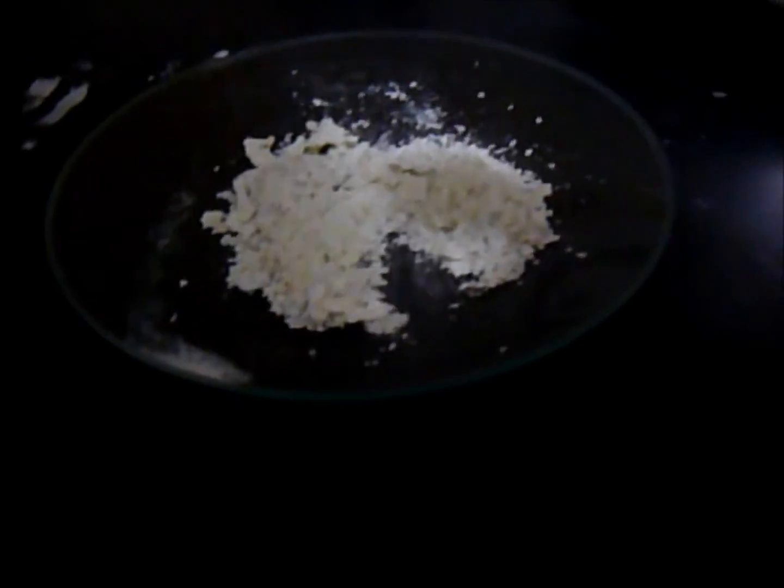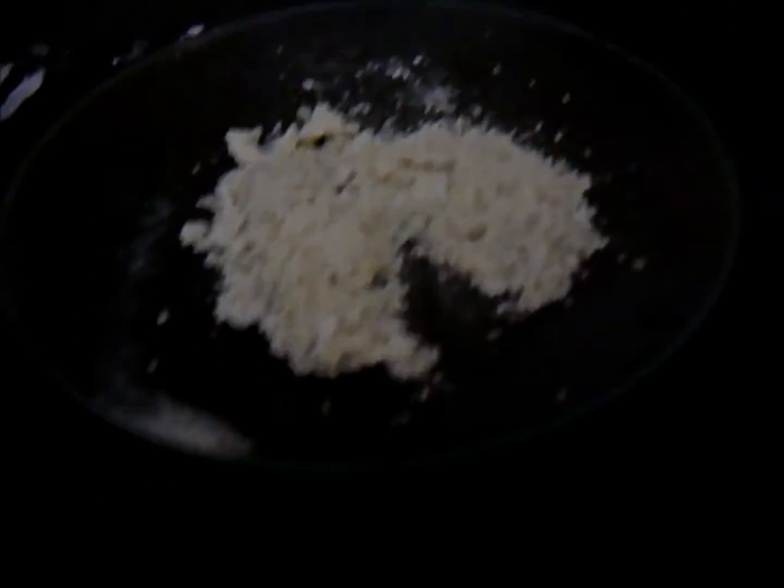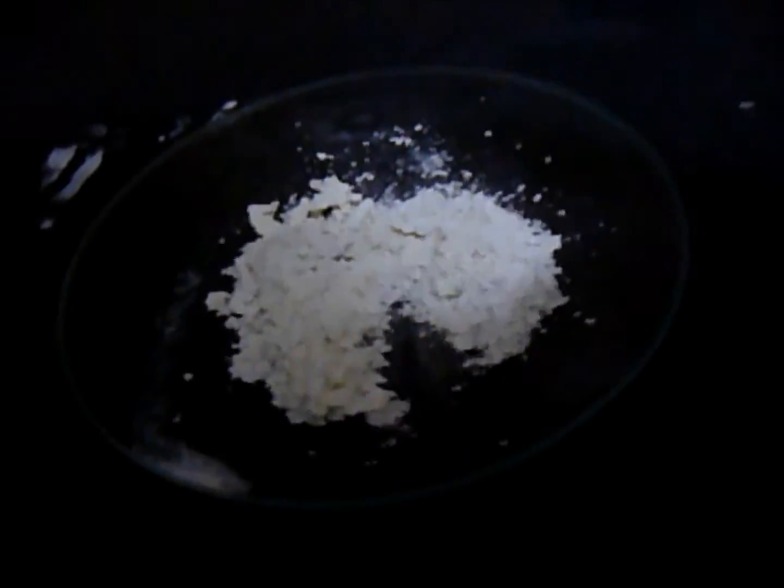So, it's a glowing dark powder, but only with black light. So, you can't just use normal light, like other glowing dark powders. So, this one, you need a fancy light. So, yeah. That's it.